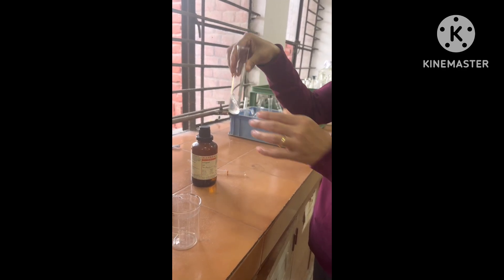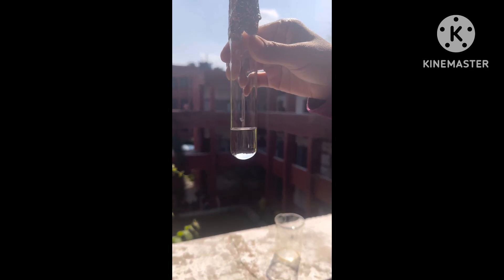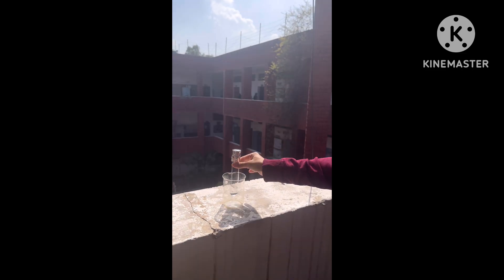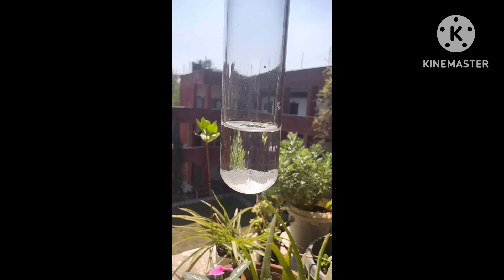A clear reaction mixture is obtained. Then cover the boiling tube with aluminum foil and keep it in bright sunlight for the next few days. The boiling tube is kept in bright sunlight for the next few days.